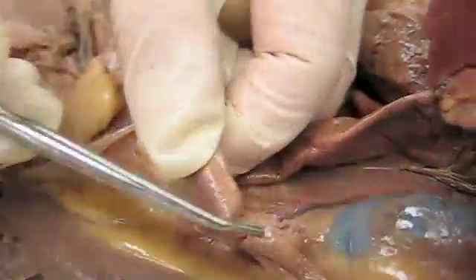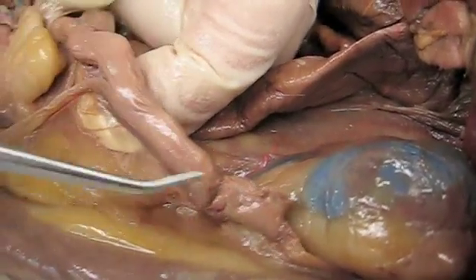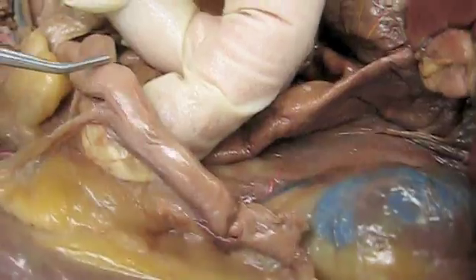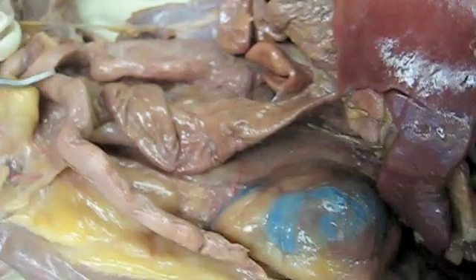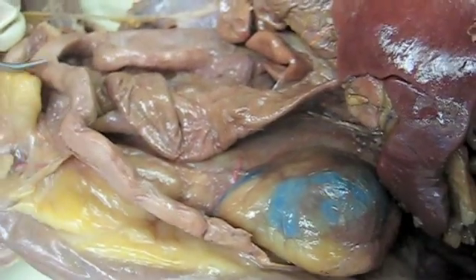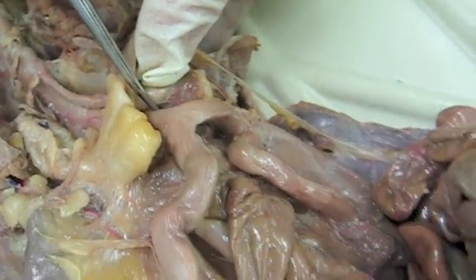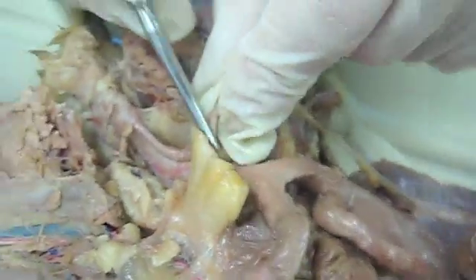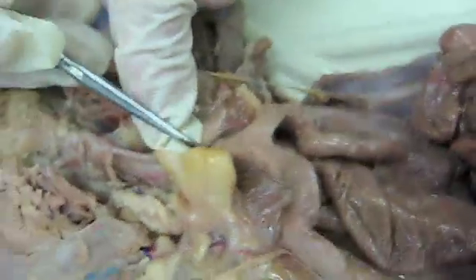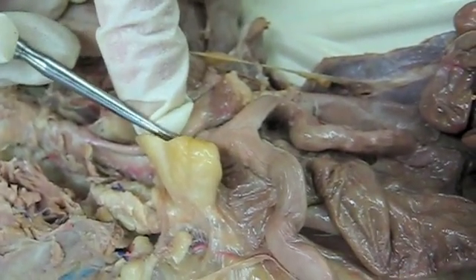The oviduct or uterine tube here is very small, and then we come into the horn of the uterus, one on each side. Then the two horns of the uterus come down here and form the body of the uterus, and then the base of the body of the uterus, which we didn't cut open, would be the cervix.